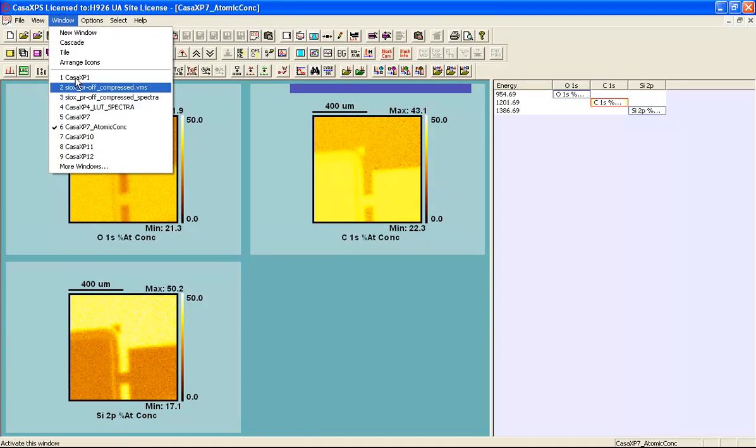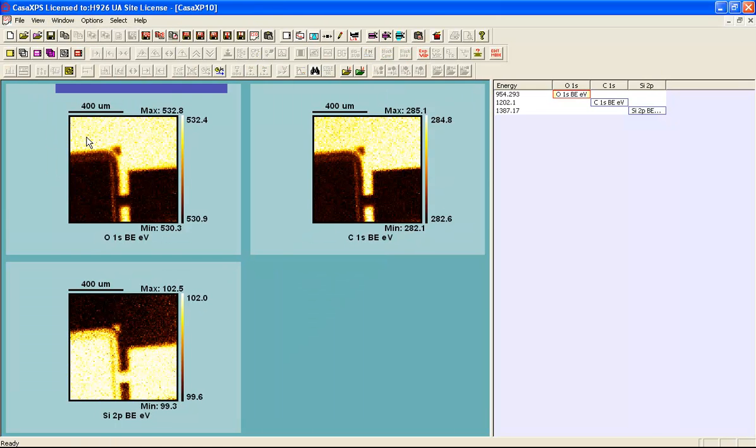Now for the consequences for charge compensation, we can look at another set of images that are constructed from the same regions on the same spectral pixels, only rather than extracting the intensity of these peaks, the position of the peaks are calculated and presented for each oxygen, carbon and silicon. And once again we can see that the carbon and the oxygen correlate quite nicely. However, the silicon is anti-correlated, and this is consistent in the sense that we understand this to be a silicon oxide on silicon, because we can see the binding energy in the dark zone is corresponding to an elemental silicon, and the binding energy for the brighter zones correspond to the oxide peak. So this is consistent with silicon oxide on silicon.